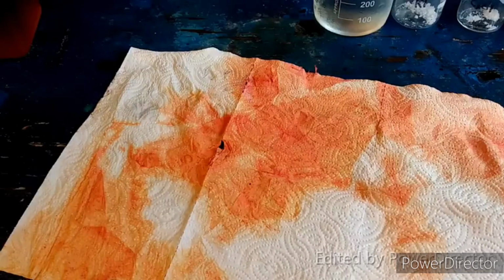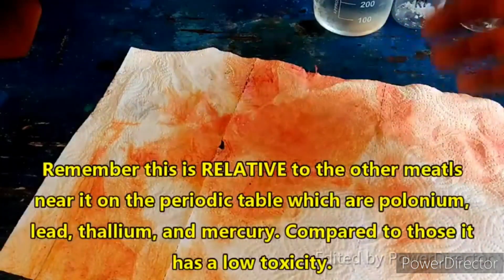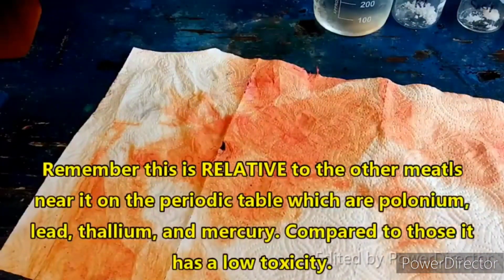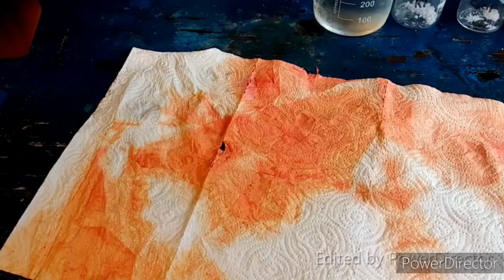But bismuth does have a markedly low toxicity for a heavy metal. That's not to say it is benign. I've been working with this with my hands, not doing anything particularly stringent other than washing them before I go to eat something, to try to prevent myself from coming into contact with it, and I've had no ill effects whatsoever.